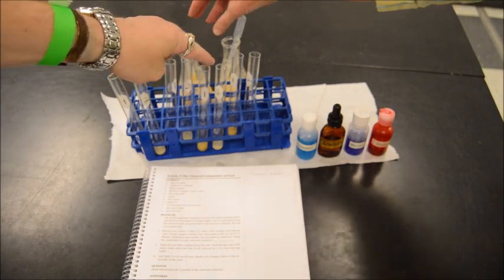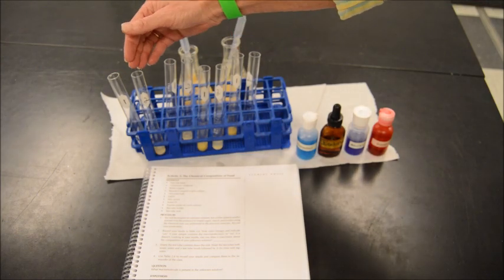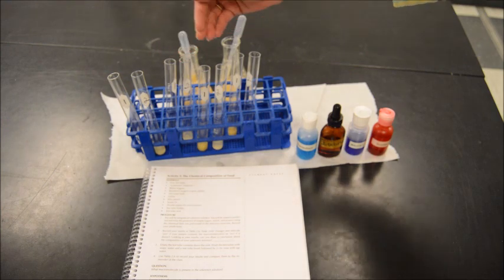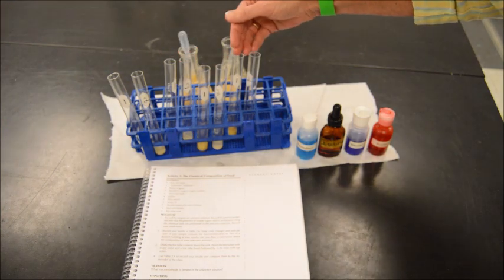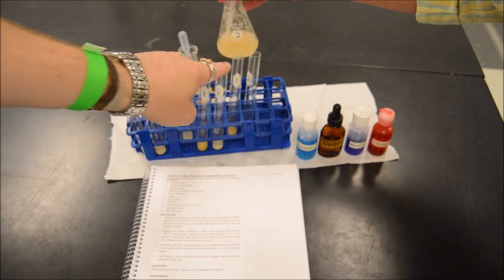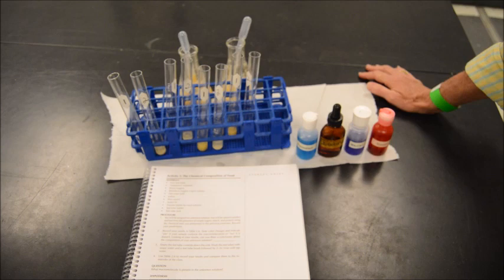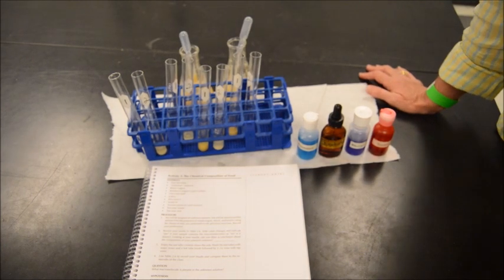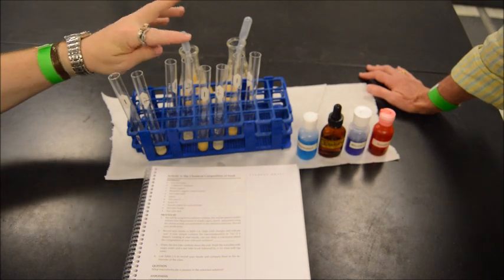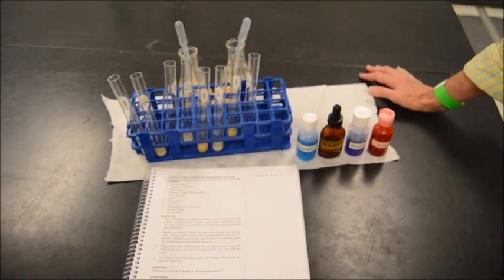1, 1, 1, 1. And this represents the 4 different tests that we do: the Benedict's, the starch test, or complex polysaccharide test, the protein test, and the lipid test. And we're going to do the same thing with unknown number 2. 2, 2, 2, 2. And so we're going to see if we can figure out. And Mr. Hopper is going to give you an idea. We're going to do a little smelling, and we're not going to do any tasting. So he's going to make some observations to you.